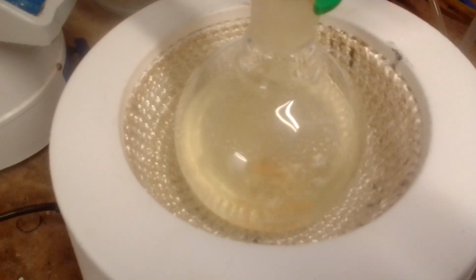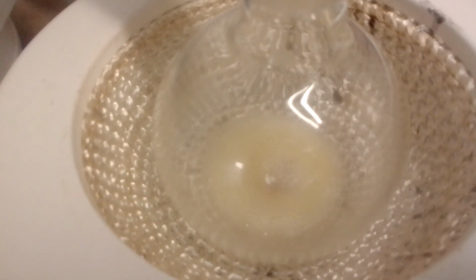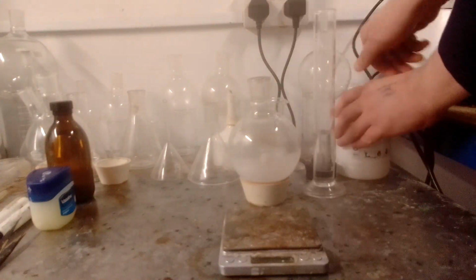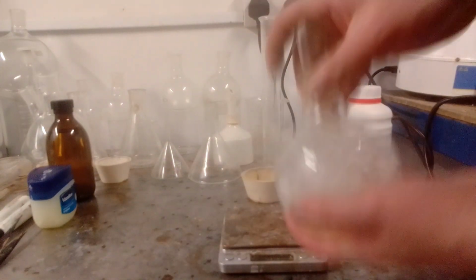As the solution got more concentrated, solids precipitated out of it and it turned opaque. Distillations were stopped when the temperature at the stillhead started falling. Once the mixture was cooled to room temperature, hexane was added to the viscous sticky orange residue, and the mixture was shaken thoroughly to extract as much soluble material as possible.